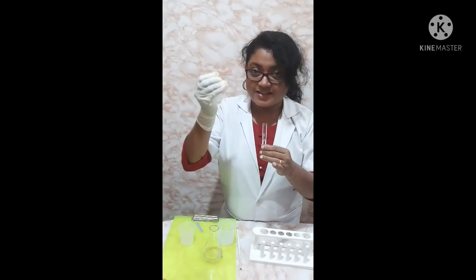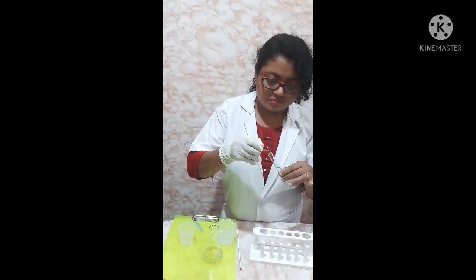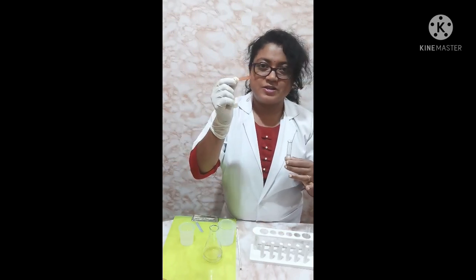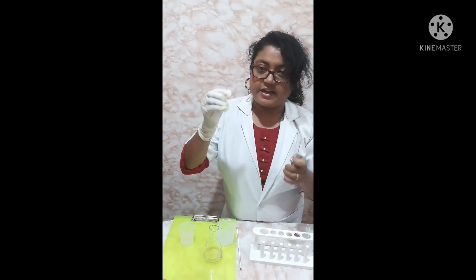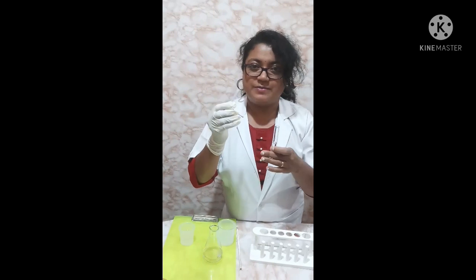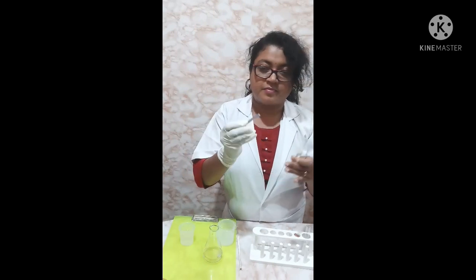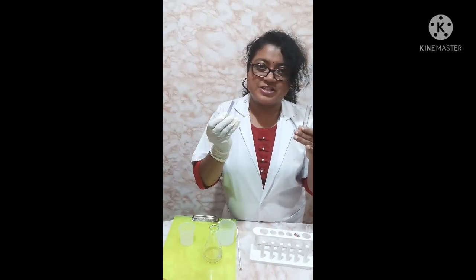Now let us check in the salt solution. This is red litmus paper — there is no change. Now let us check this blue litmus paper — there is no visible color change.